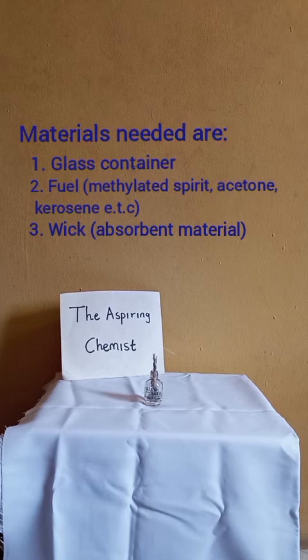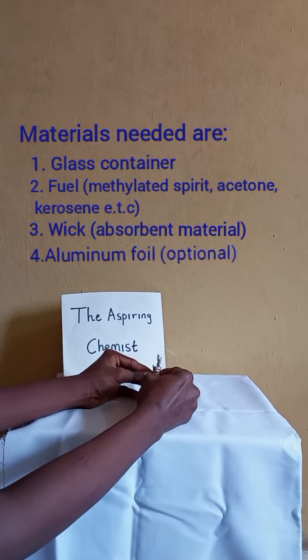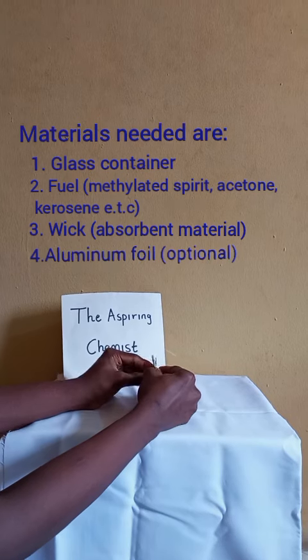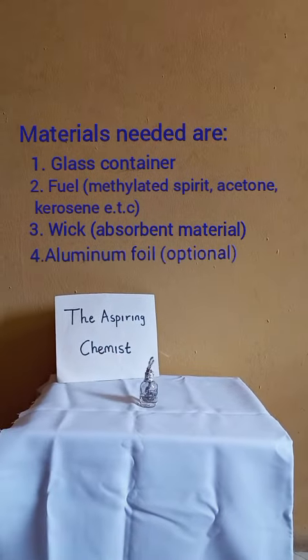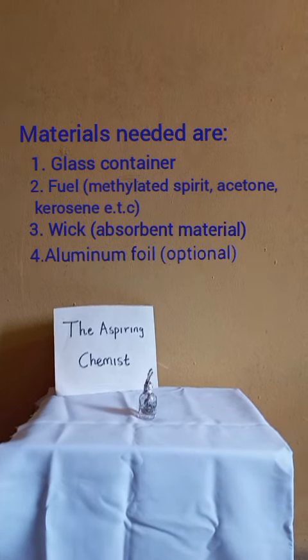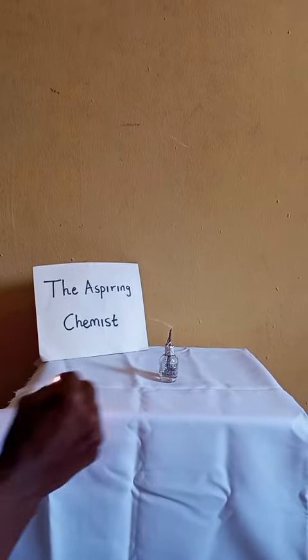Then I'll add this little foil of aluminum so that I can control the path where the fire will take. Then we'll allow the wick to absorb the fuel. So let's test it.